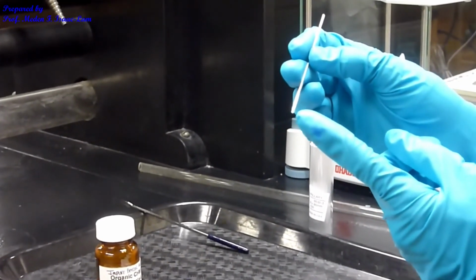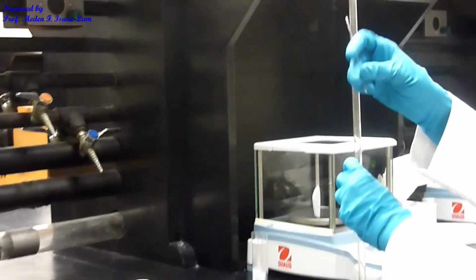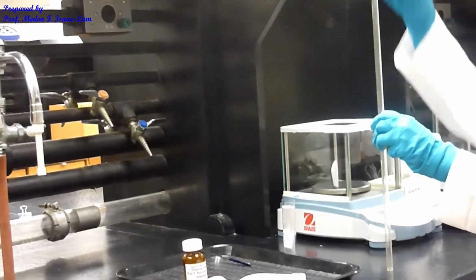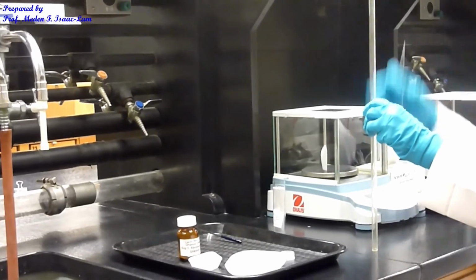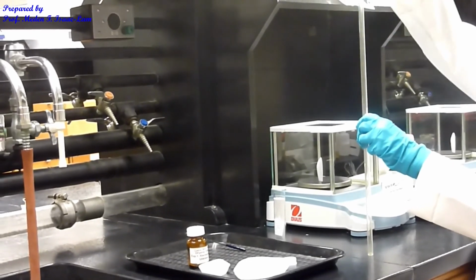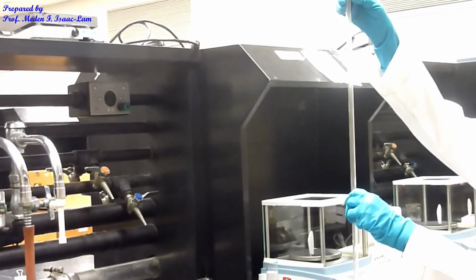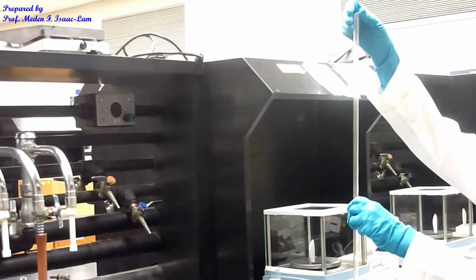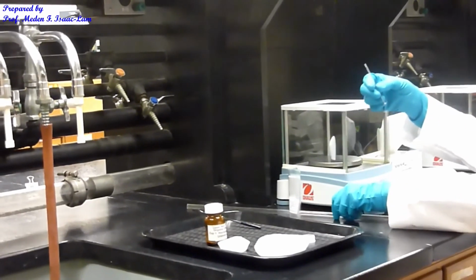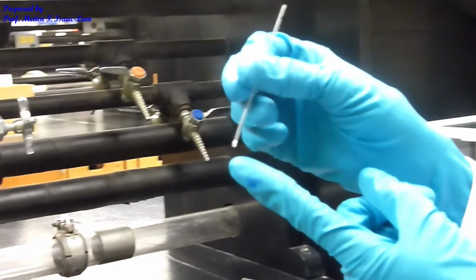So I still have a little bit to go. Okay, so I'm gonna do it several times to pack. So this is the tube, and I have some crystals here on top, and I'm going to drop it on this glass tubing, open end, but the diameter is bigger than my capillary tube. So I'm going to drop it on top, okay, and then so that I'm packing the closed end. So I think I have enough already. So as you can see, I have now the sample at the closed end.